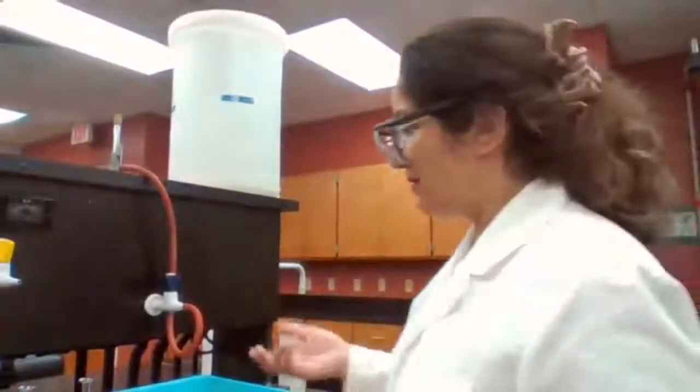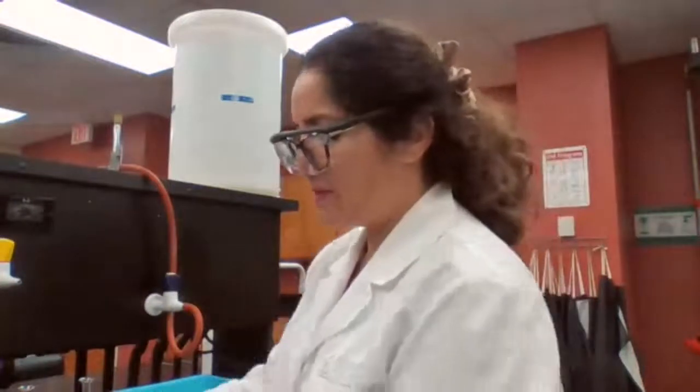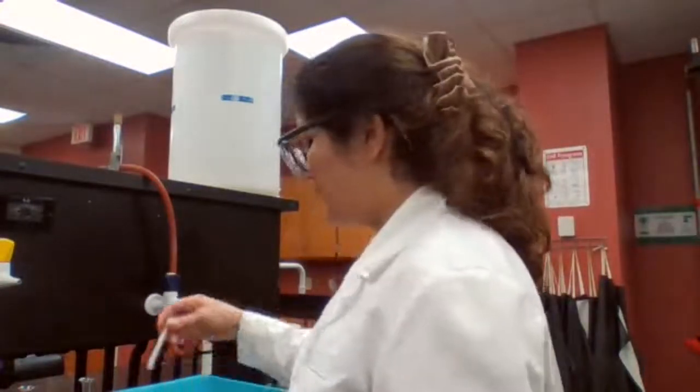Sometimes when they tell you to do a measurement, if you look at the introduction part of the lab manual, it also explains. If they say measure exactly 3 milliliters, then we have to use the exact measurement device. But if they tell you just measure about 3 milliliters, it doesn't have to be exact. So you can do an approximate measurement.